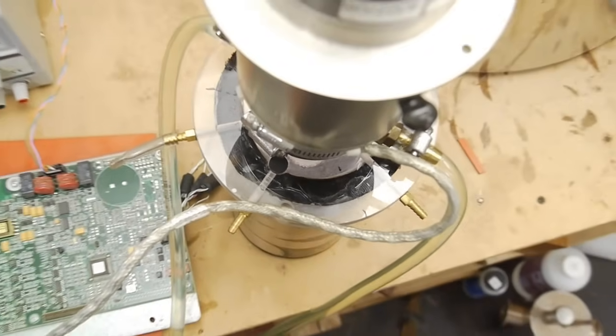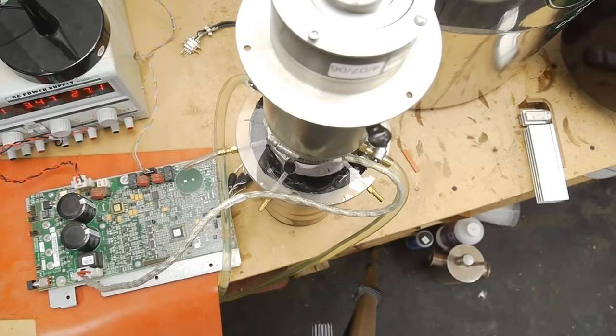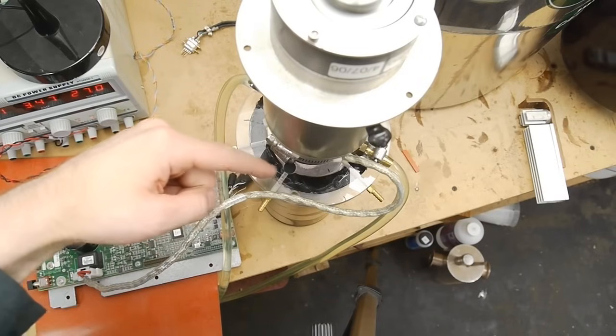Okay we've only been running for about 20 minutes here we've got the power cranked up to 150 watts input power and we're looking down into the dewar there and what you're seeing dripping off is the liquid air. It's covered in snow that's the tip of the cryo cooler that's very cold but you'll see every once in a while a drop comes off and that's a mixture of liquid oxygen and liquid nitrogen and it's hitting the bottom of the flask and hopefully being collected. Right now there's no filtering going on so it's going to get very snowy in there because the air has a lot of water in it and it's currently just pulling in atmospheric air through these open ports.